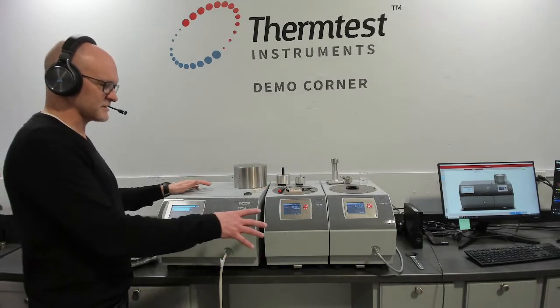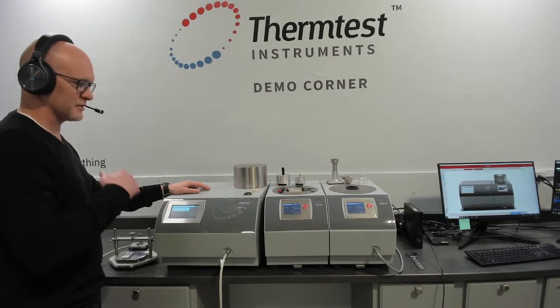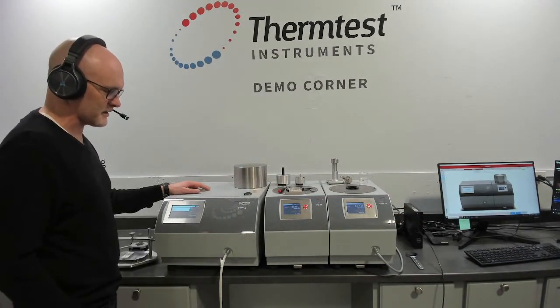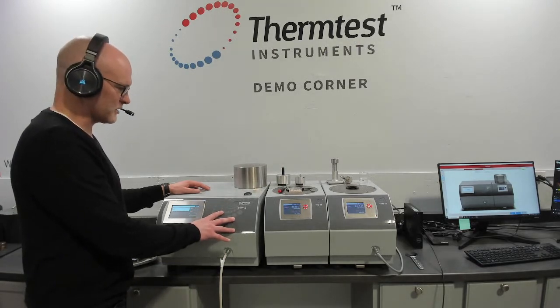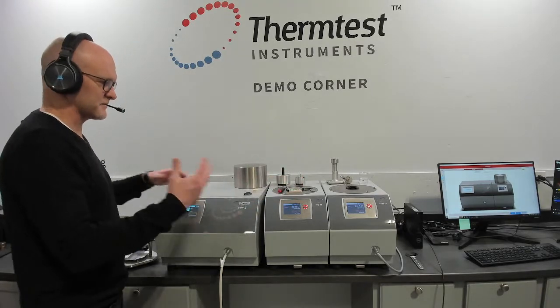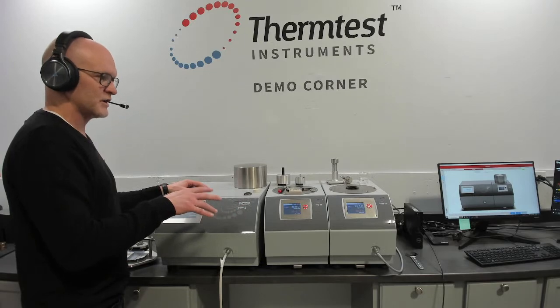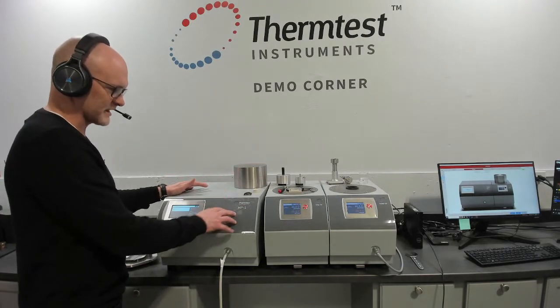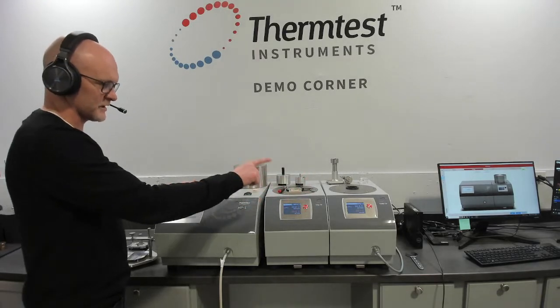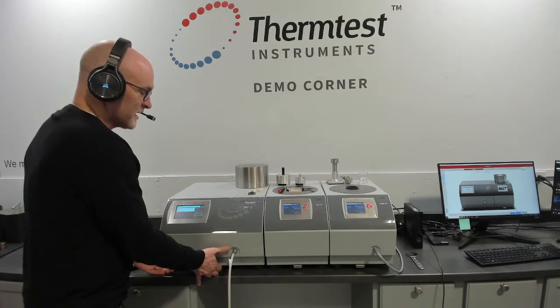We have some customers that look for 2 transient plane source temperature platforms side by side, so any variation of. There is a MP-1 switch demo where we show all the variations to sort of generate the ideas. If you have a high volume or diverse range needs for your lab, how you can package the MP-1 together with the various channels, working with the platforms to sort of maximize your requirements.